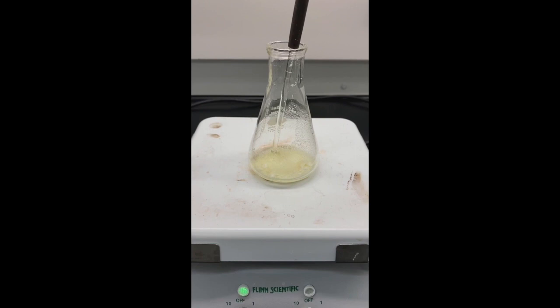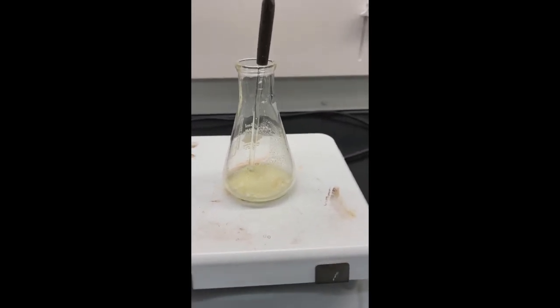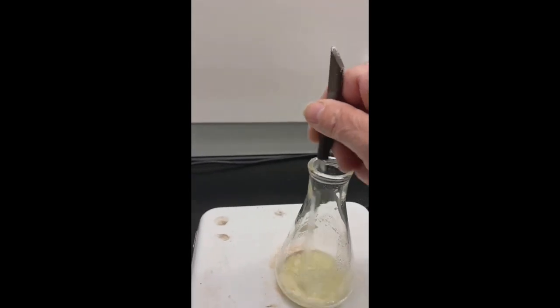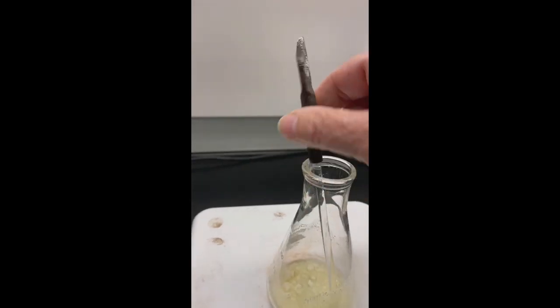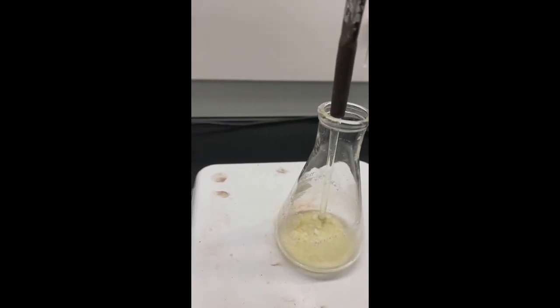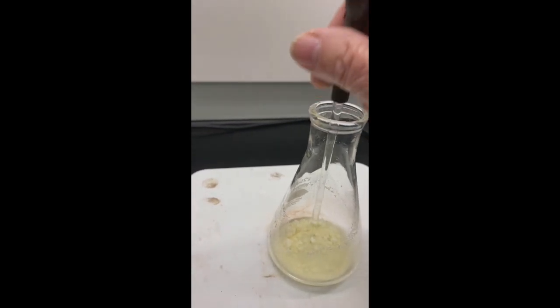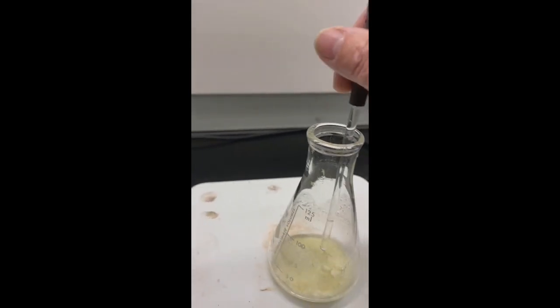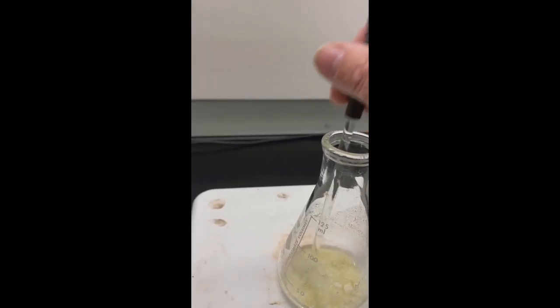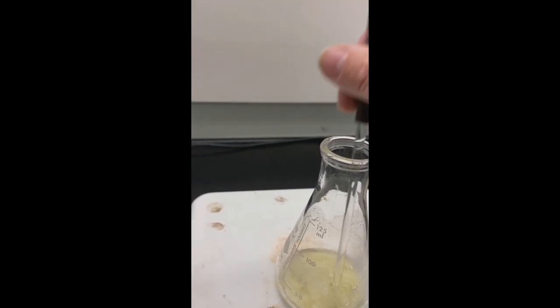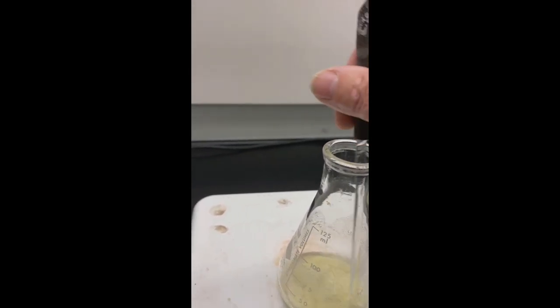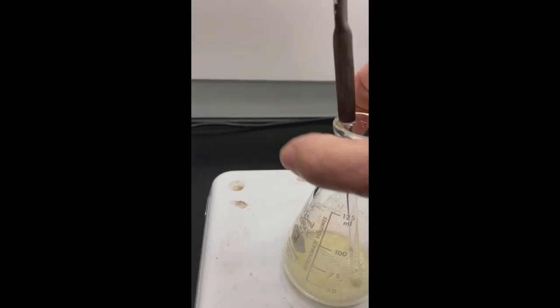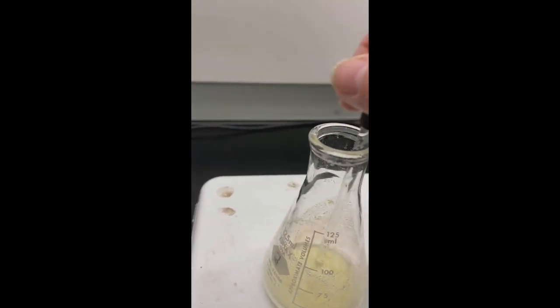We're back on the hood again. We want the hood to take away the methanol vapor that releases. I'm going to be heating this until all the solid dissolves. That's what recrystallization is, is you bring it back into the dissolved state and those crystal impurities that got caught within our crystals are supposed to release, and then we're going to crystallize it a second time. That's why it's called recrystallization, and that will be a much more pure compound. So it's possible I have to bring this to a boil. It's possible I might have to add a little bit more methanol to make sure everything dissolves, but I don't want to add too much.